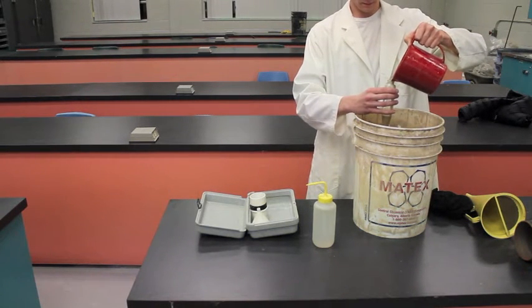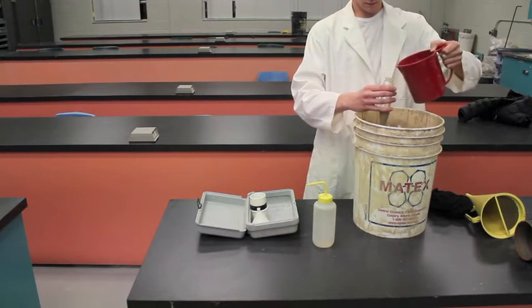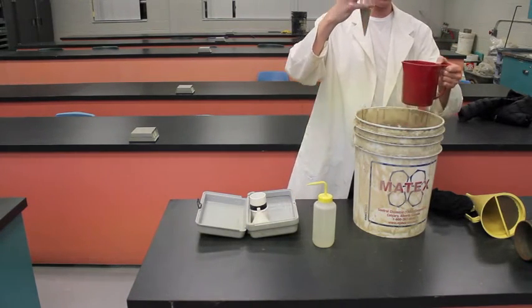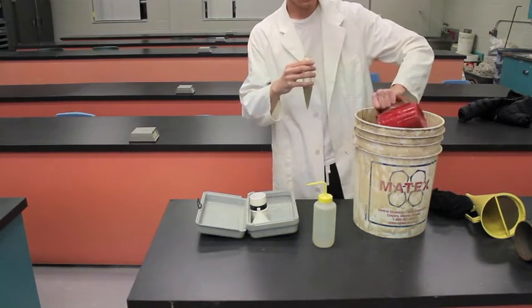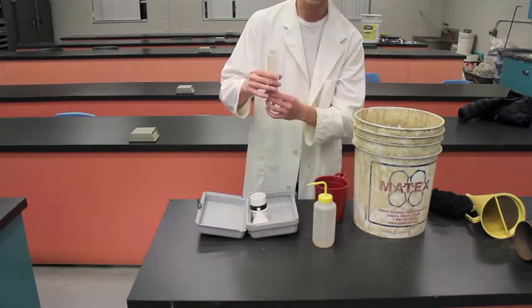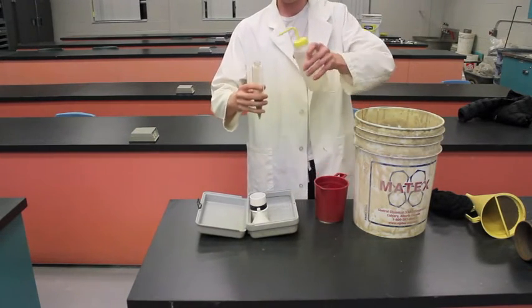You don't want to go over. So, there you have it right there. We have our mud to here line filled with our mud, and now I'm just going to top it up with water.